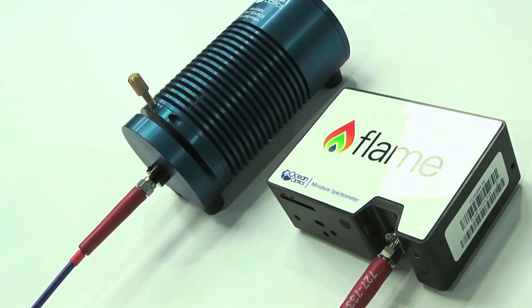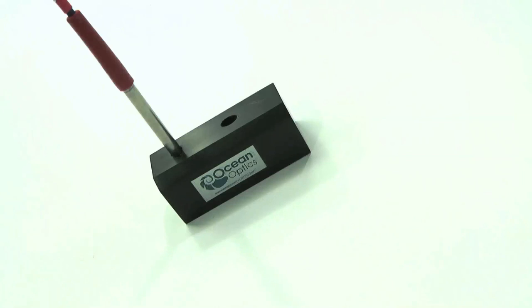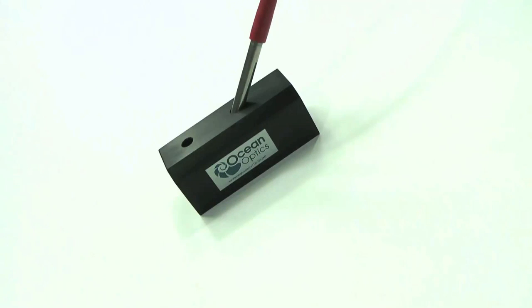Then place the probe end into your reflectance probe holder. Use a 90 degree angle for specular reflection and a 45 degree angle for measuring diffuse reflection.